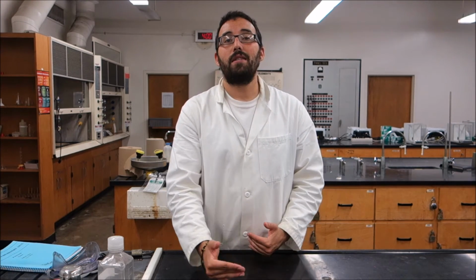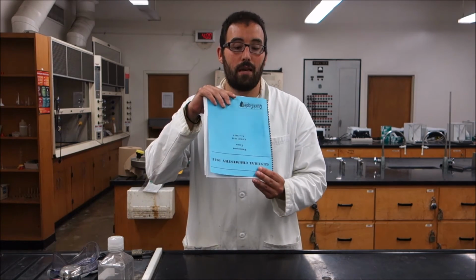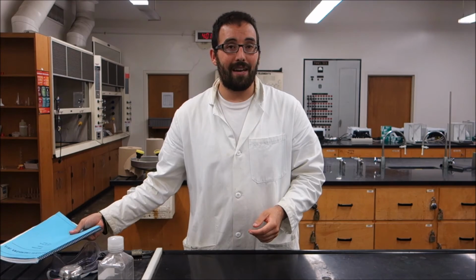Now, the first thing we're going to do is look at a helium lab. We're going to take our data from the helium lab, and it's going to be a set of distances that you actually measure out, and that'll be your y-axis. And we're going to compare them versus the wavelengths. The wavelengths for helium can be found in your Chemistry 101 manual. This guy right here, upside down, actually has the wavelengths, and you'll find that in your experiment number 9 section. So you're going to make a chart comparing your distances versus wavelengths, your measured versus your controlled.